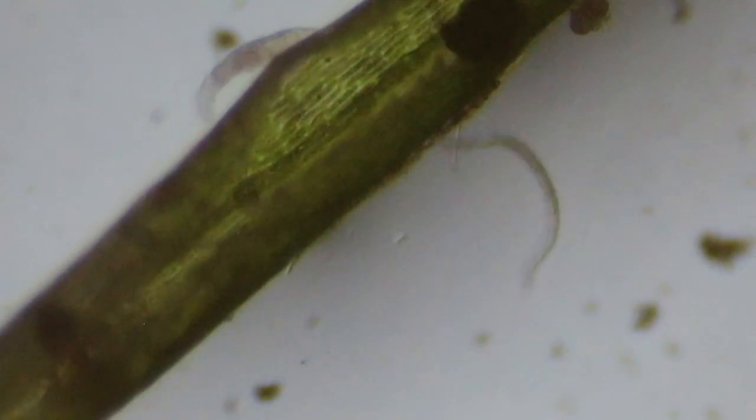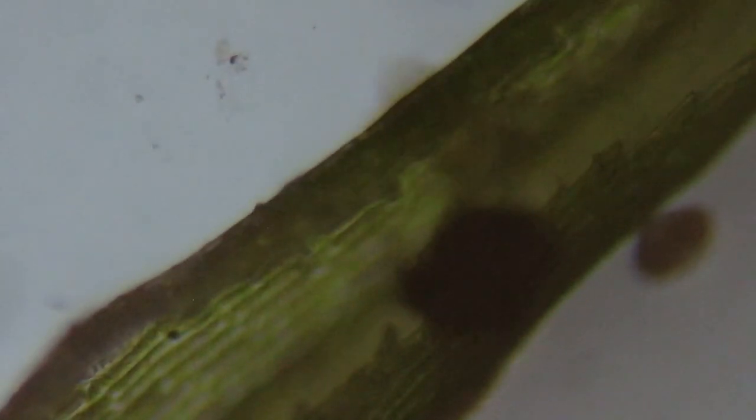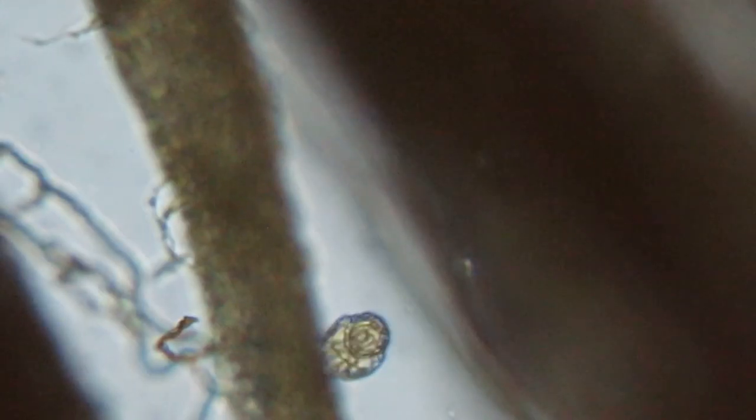Who is that — I think that's gonna be our star of the show. He looks like an inchworm, right? But he's definitely not an inchworm — this guy is a rotifer. They live on the moss in that thin layer of water. They're able to encyst into a kind of protective shell when the moss dries out. You can see him kind of inching along — he uses the front of his body to stick to the cover slip, and then at the end he has a little foot. There are usually two little toes on there that he uses to hold on to whatever he's hanging on. I just wanted to show you how they move.